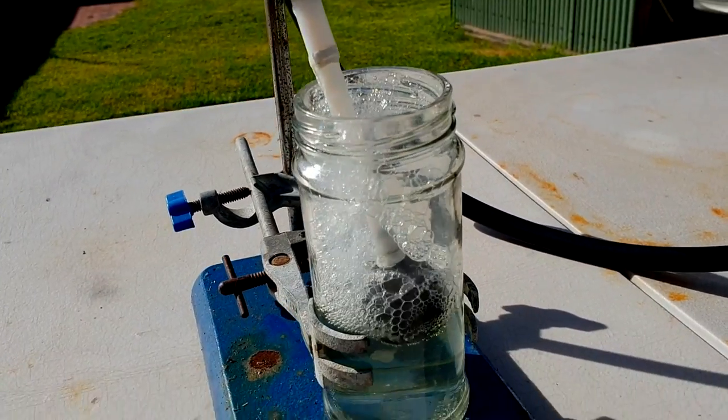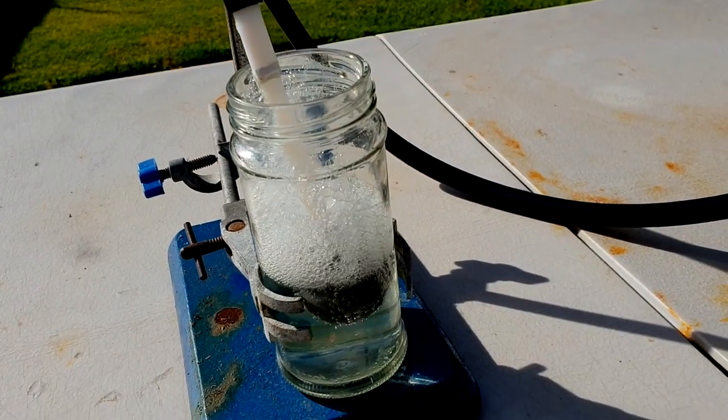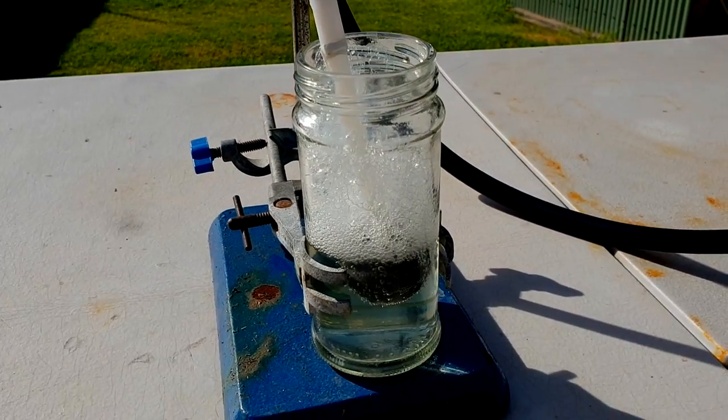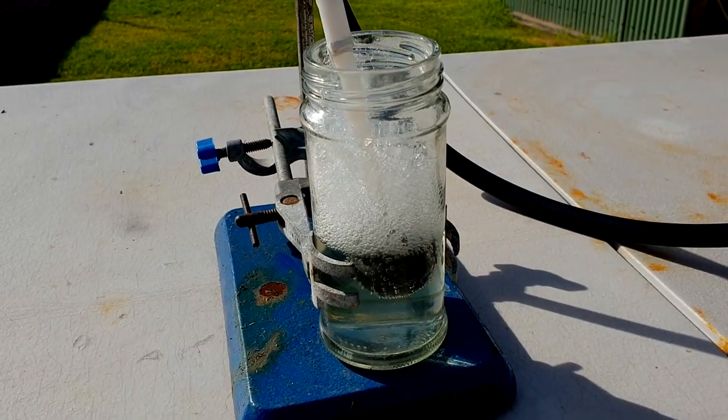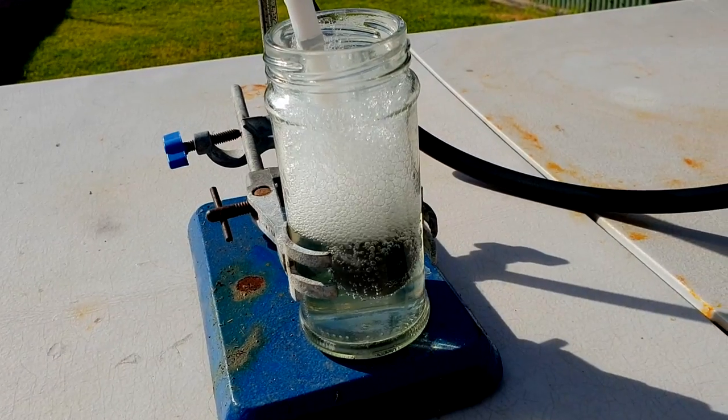But the bubbling is getting very annoying, because I want to be able to immerse this thing all the way down the bottom so we get the biggest gas capture. But as we can see, even if we half immerse it, the stuff starts to bubble all the way up to the top of the jar. So, maybe I should change container or something.